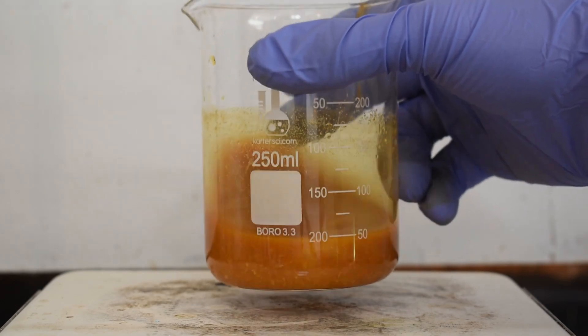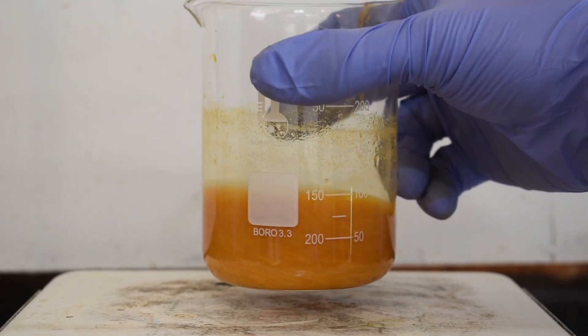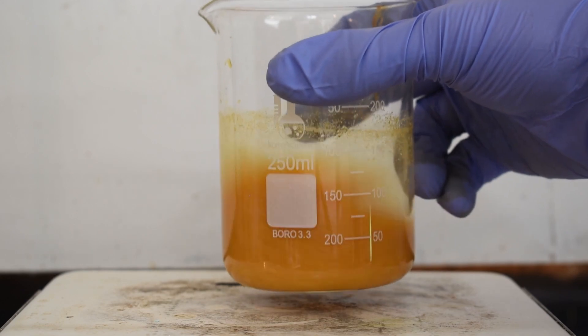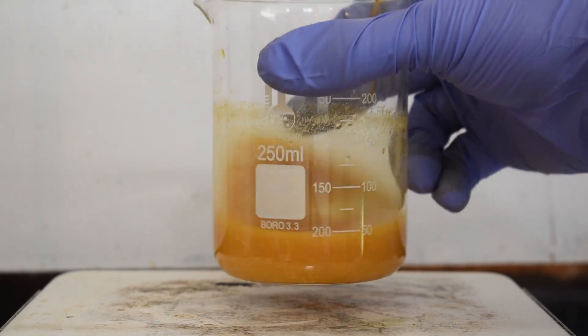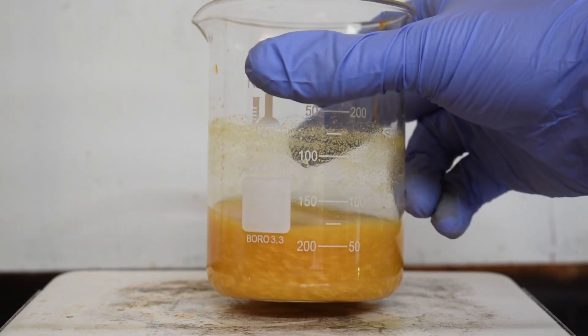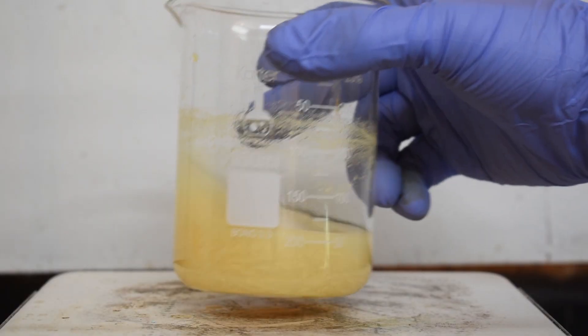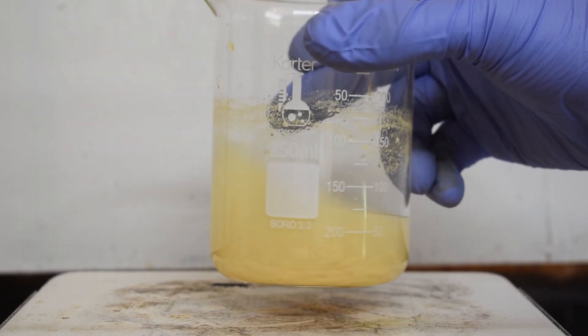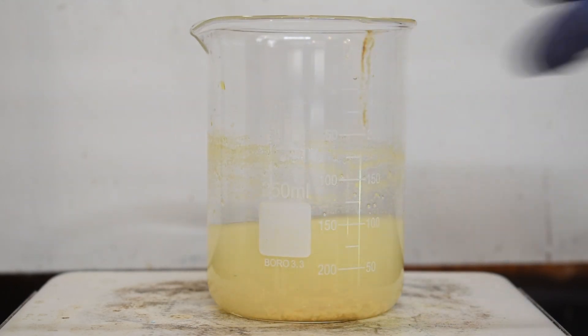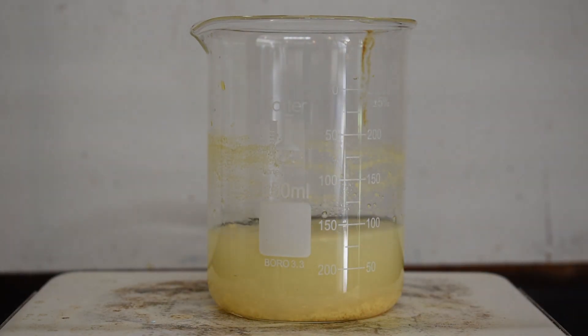Anyway I let the entirety of the sodium hydroxide solution drip into our reaction and this is kind of bad because iodoform actually reacts with hydroxides to form the iodide ion again. In total I added about probably 1.5 grams of sodium hydroxide and this definitely hurt my yield quite a bit. I definitely recommend just being more patient and trusting the process and using just as much sodium hydroxide as you need to complete the reaction.